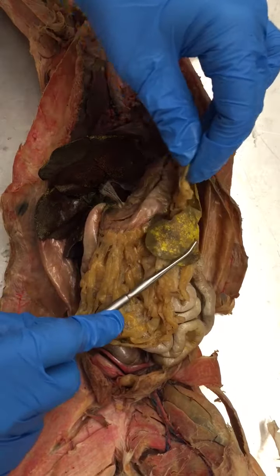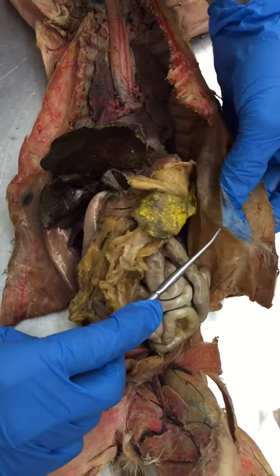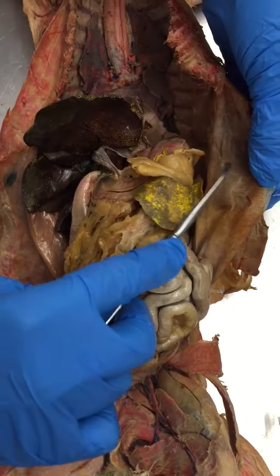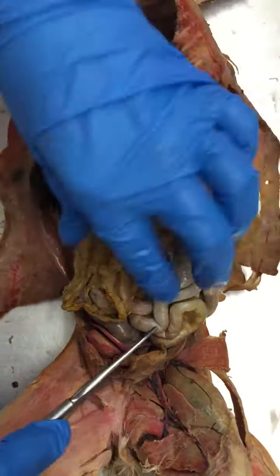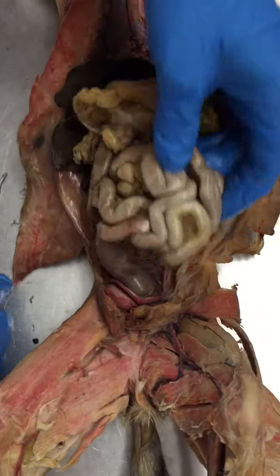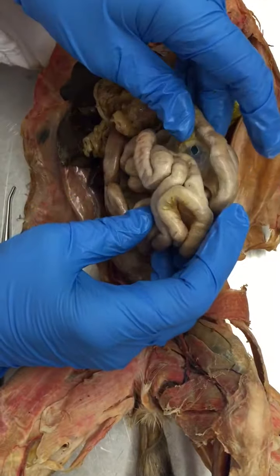Gastro for stomach, splenic for spleen. The tissues that line the abdominal cavity — this opaque membrane lining the abdominal cavity — is your parietal peritoneum. We can pull up on that right there, and covering the surface of all the organs, including the stomach, the liver, and the intestines, is a visceral peritoneum. The space between the two would be the peritoneal cavity with serous fluid.